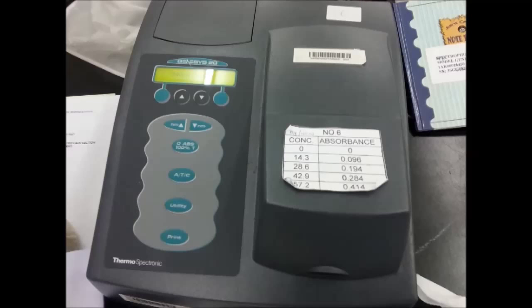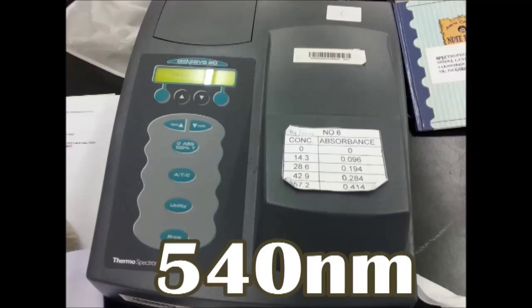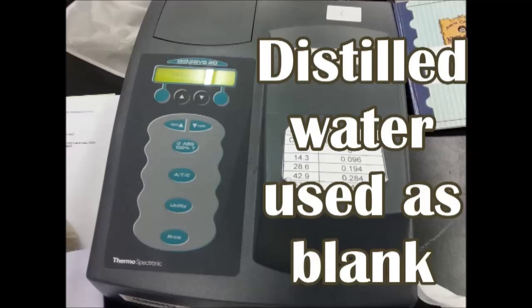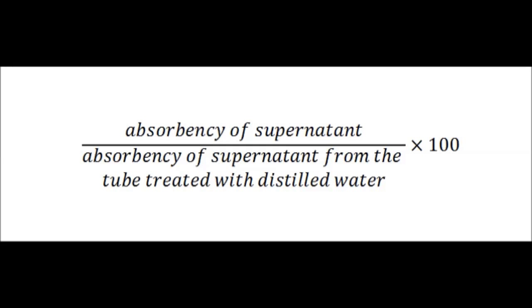The absorbance of the supernatants in each test tube is determined using the spectrometer. The spectrometer is set at a wavelength of 540 nanometers, and distilled water is used as a blank to zero it. The absorbance values of the supernatants are used to calculate the percentage of hemolysis using this equation.